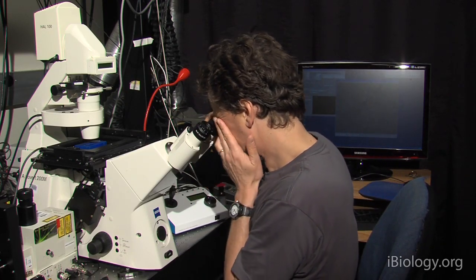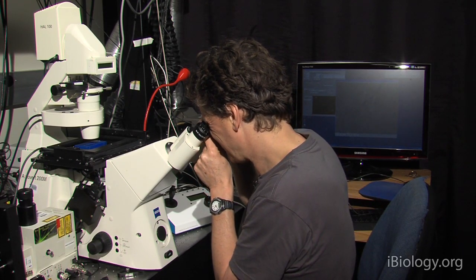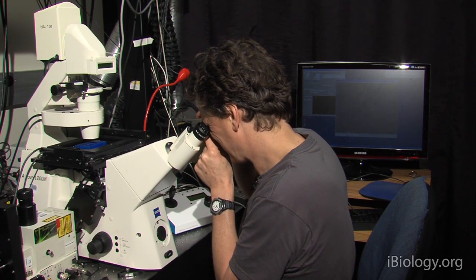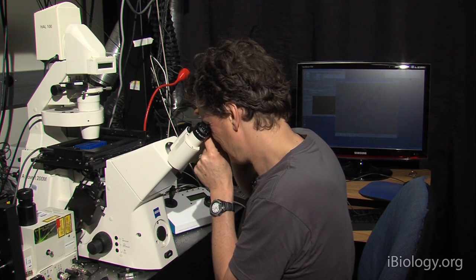So, I focus the left eye and now, keeping my right eye closed, sorry, my left eye closed, I'll focus the right eyepiece.